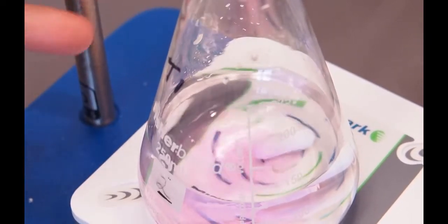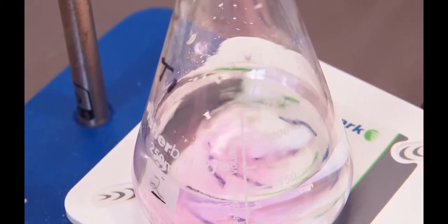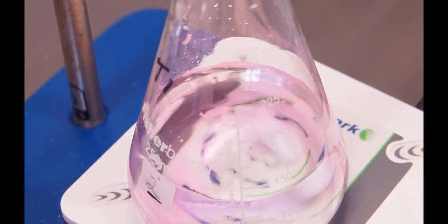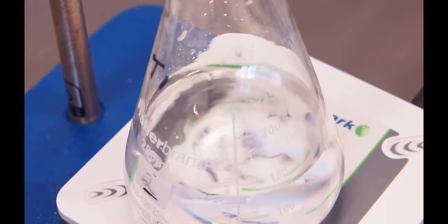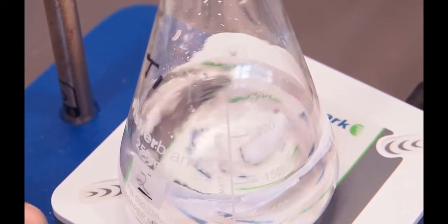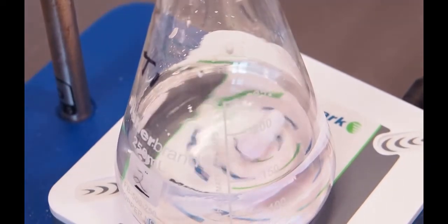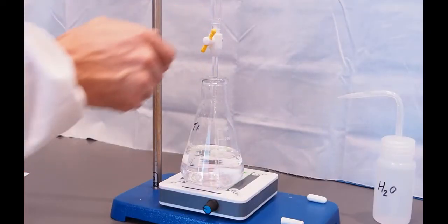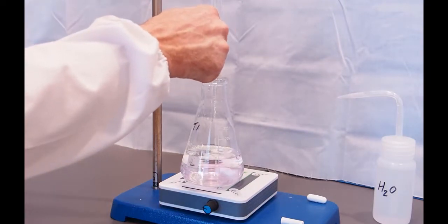Okay, so I've got my drops. I slowed down the drops, and I can see pink beginning to develop. If I turn the stirrer on, it mixes it away more quickly. But you can clearly see that it is turning pink for just a moment as I get towards my end point. And now I've got a very slow drip rate.